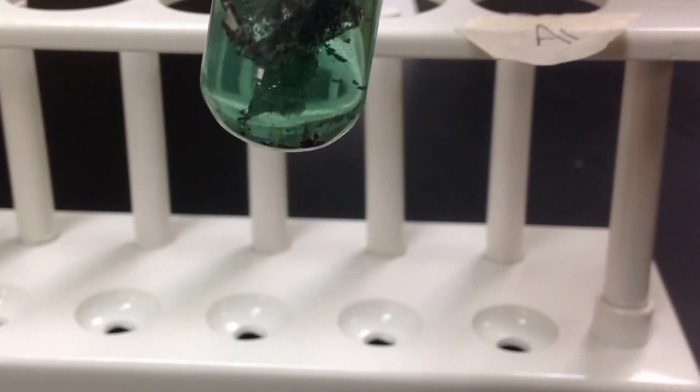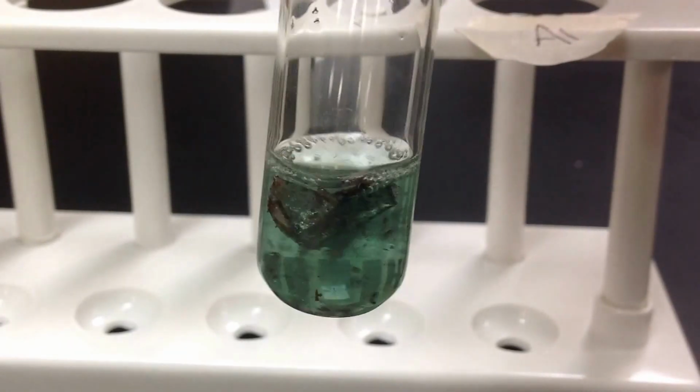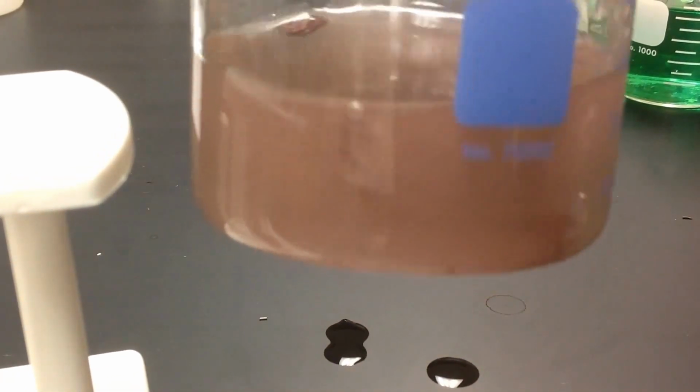And for the aluminum, you can start to see there are these reddish brown flakes, and the aluminum foil is actually dissolving. And the solution is becoming less green. So if we look at just the waste jar for this reaction, this is what it eventually will look like. Now this is a little tinged green still, but if we swirl it, you can see that green kind of goes away, and you can see there are chunks of copper metal.